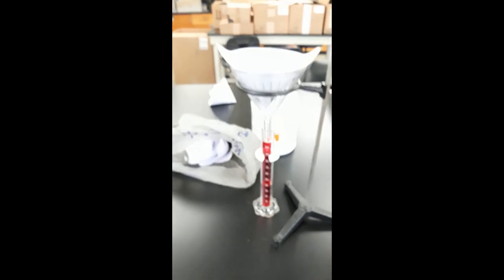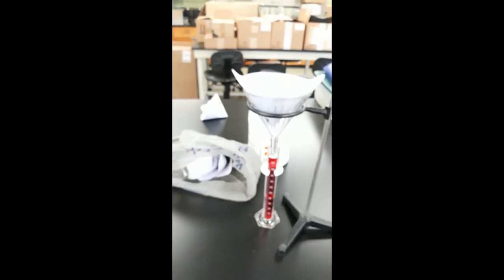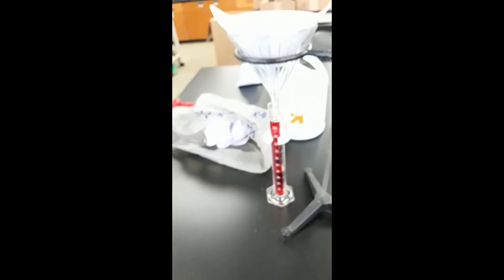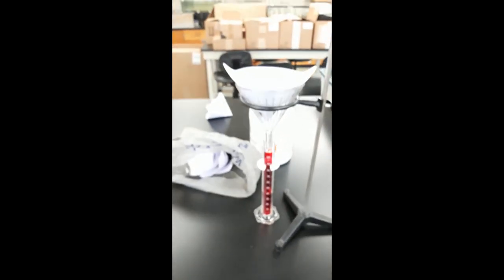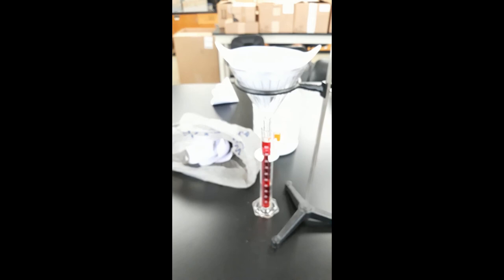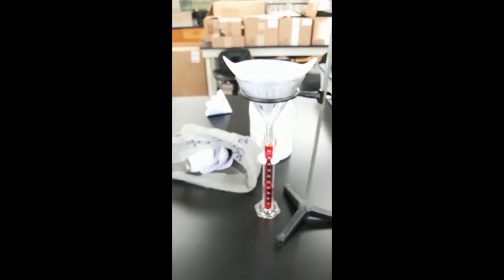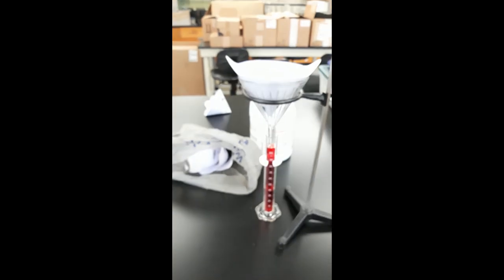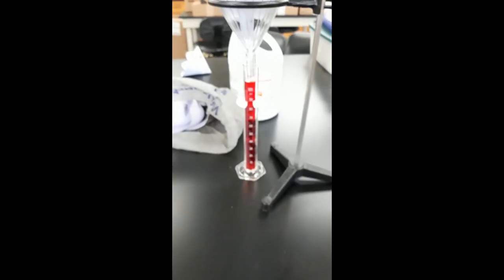So I want you to record your data in your lab notebook and analyze the data and see which concentration do you think gave the best result as far as removing the most water and the quickest.